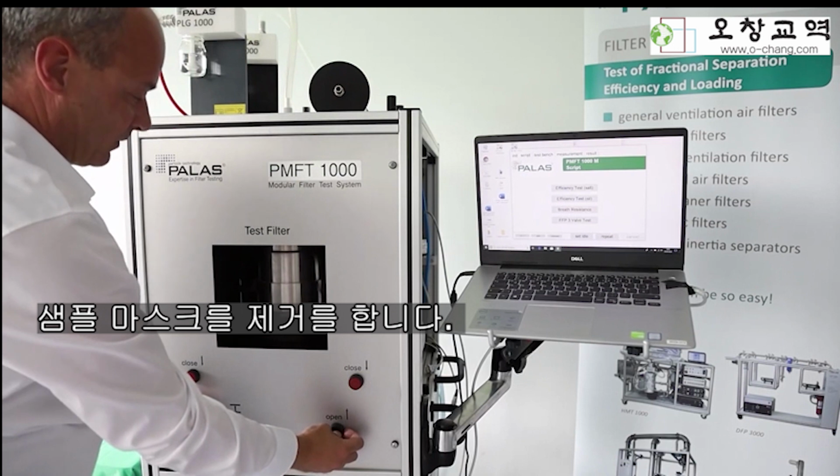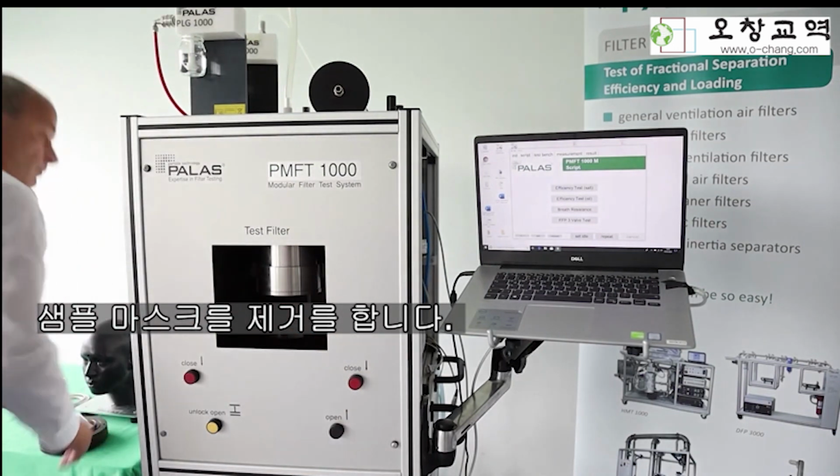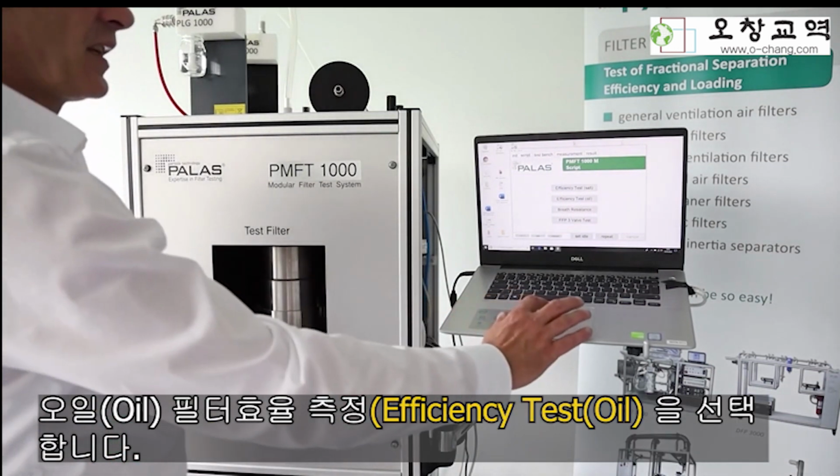Remove the mask. And start the efficiency test with oil.